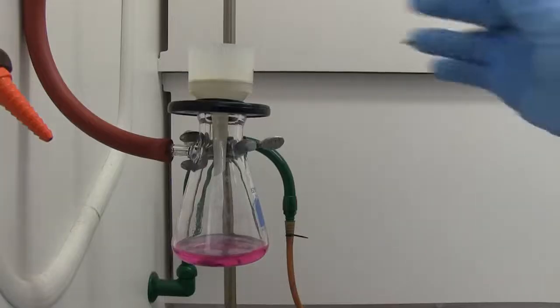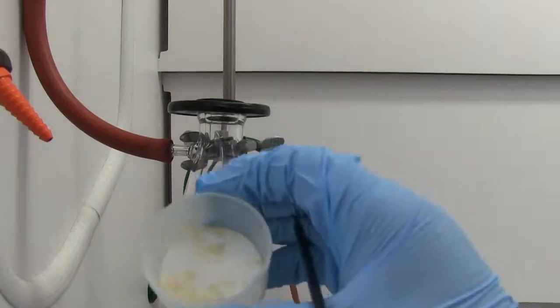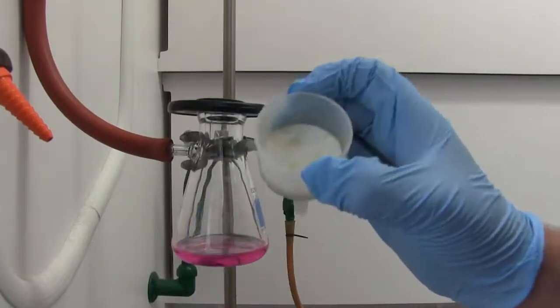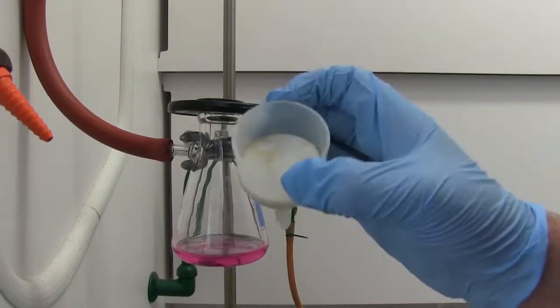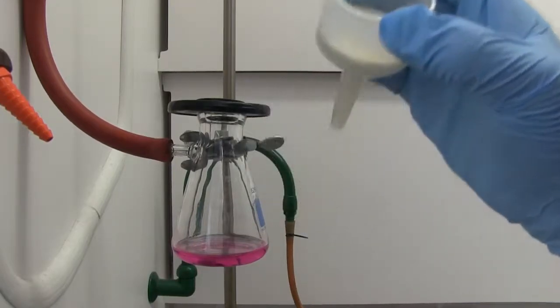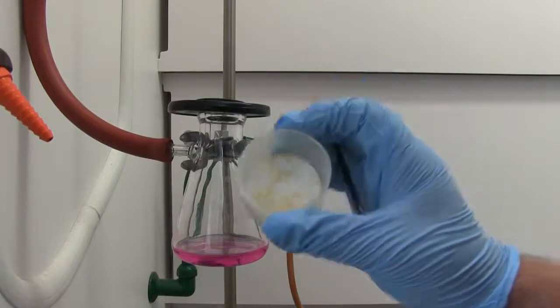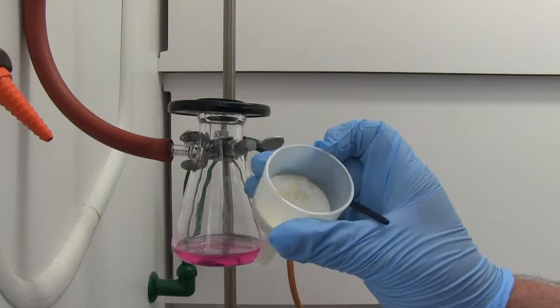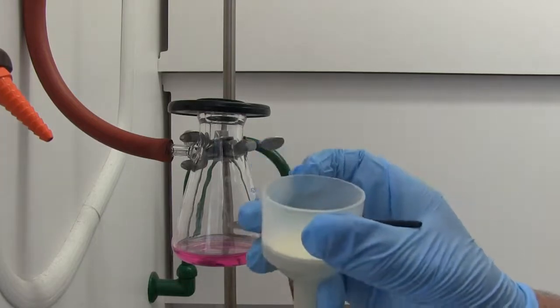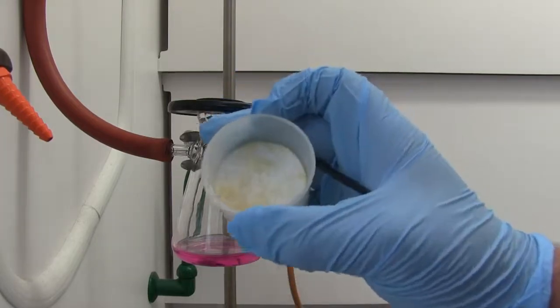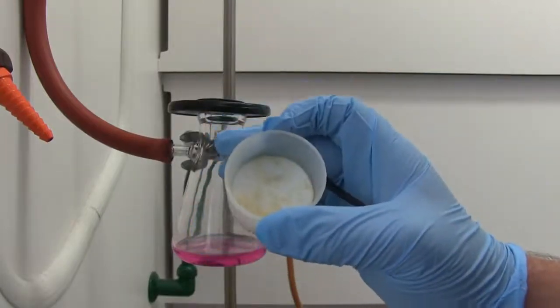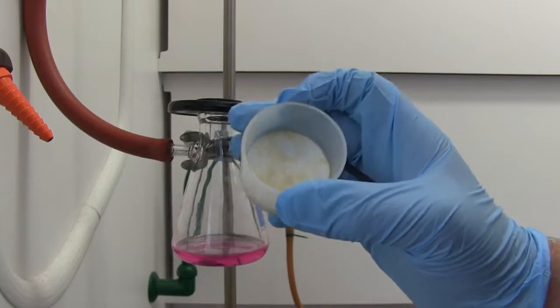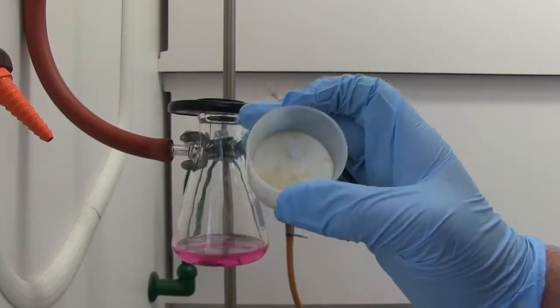All right, so I've let our product dry. Let's show you its appearance. It definitely, it is some nice crystals but it's definitely still got a lot of yellow in it. You have two weeks to perform this lab so you have plenty of time. I would recommend recrystallizing this again. That yellow means there's some impurities. There is a lot of white in there as well but that yellow means there's definitely some impurities. I'm running low on time so I'm just going to go ahead and run with this but if you have the time, definitely recrystallize to get a better result.